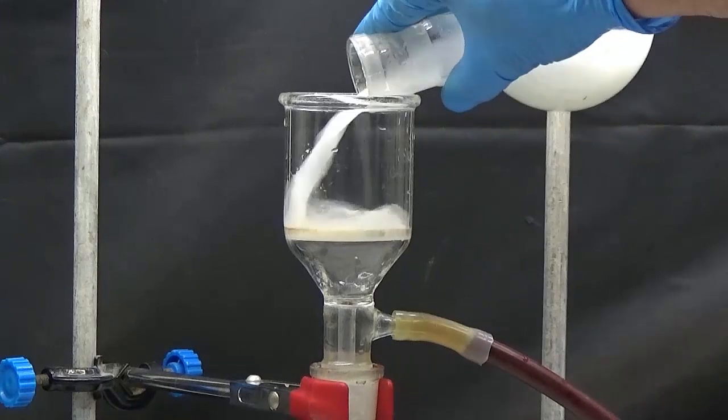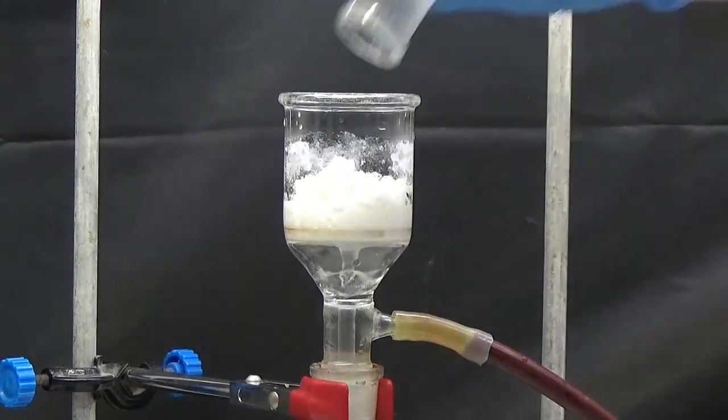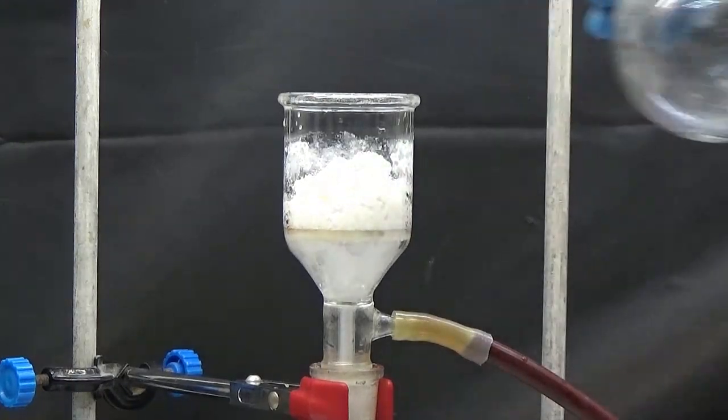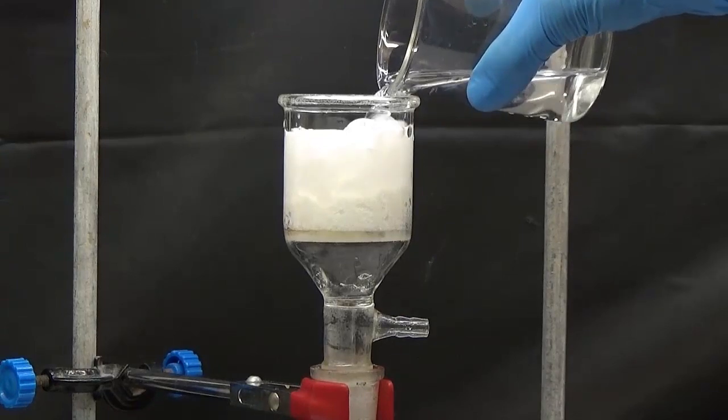Collect the solid by suction. Wash the solid with a small amount of cool water.